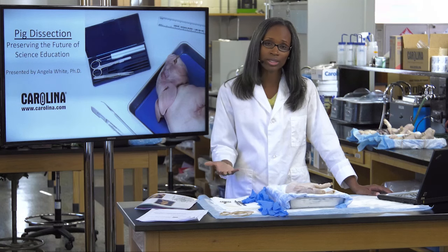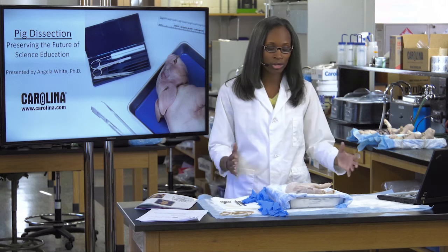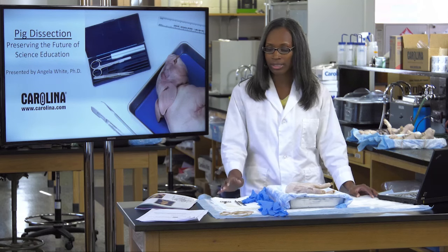I want to share just a couple of goals for today's webinar. One of the goals is to really help you all become more comfortable with using pigs in your classroom to address some of the Next Generation Science Standards. Additionally, we are seeking to introduce you to mammalian anatomy and help you see how this dissection experience is aligned with the Next Generation Science Standards.